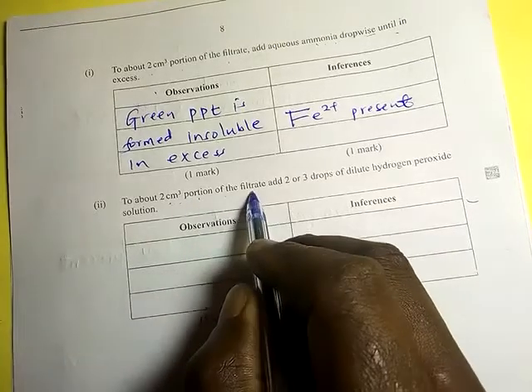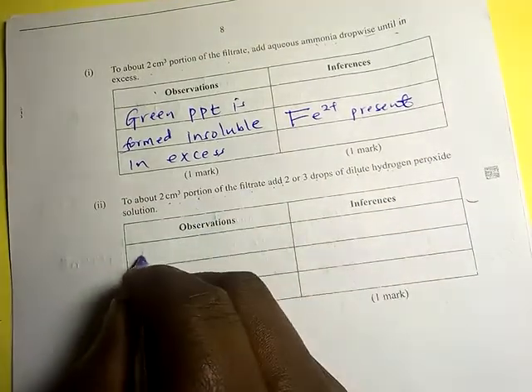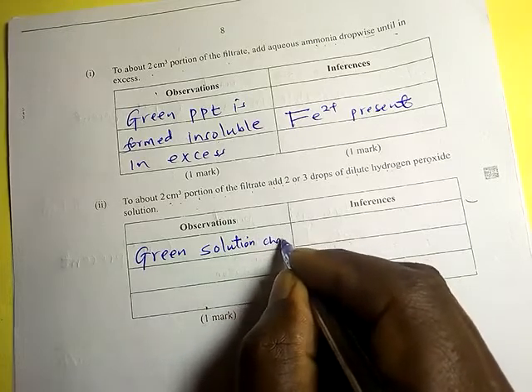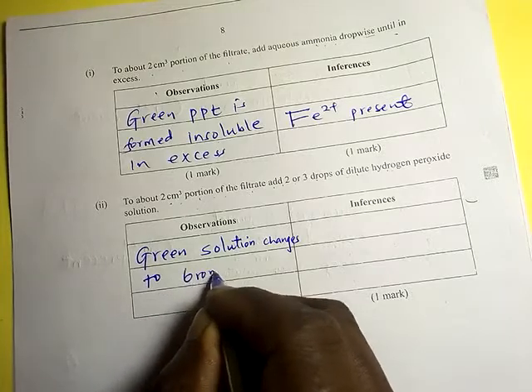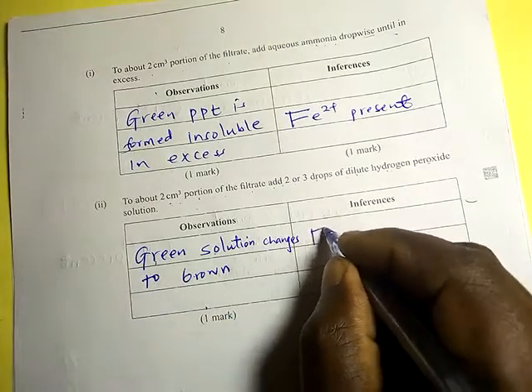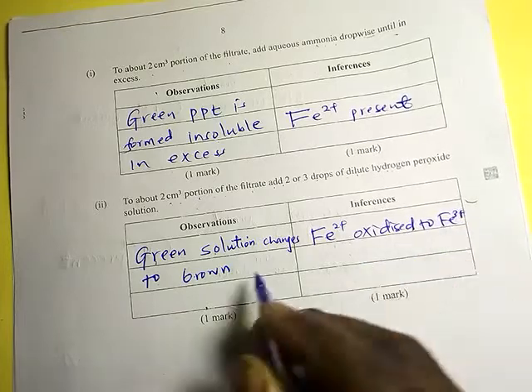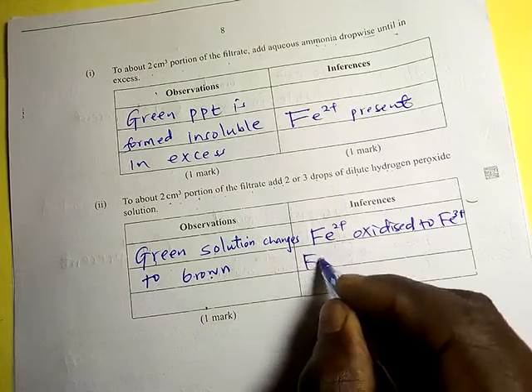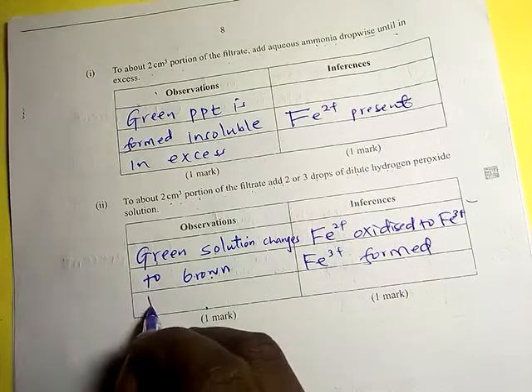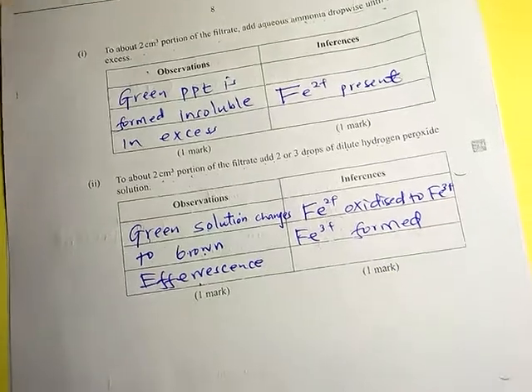To about 2 cm³ portion of the filtrate, add two to three drops of dilute hydrogen peroxide solution. The observation is that the green solution changes to brown. This means iron two has been oxidized to iron three, because iron three ions are the ones which are brown. Iron three is formed. You also expect effervescence here.